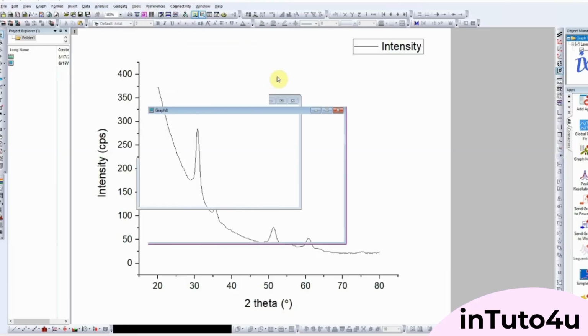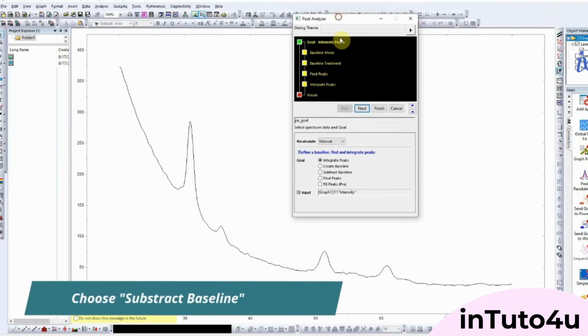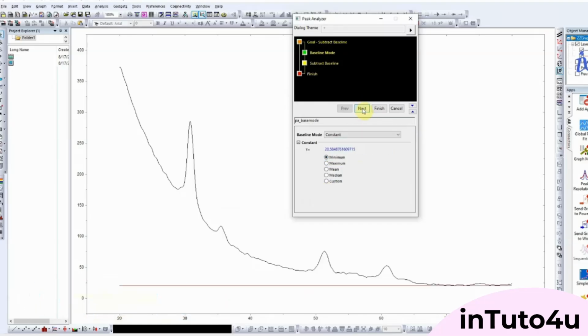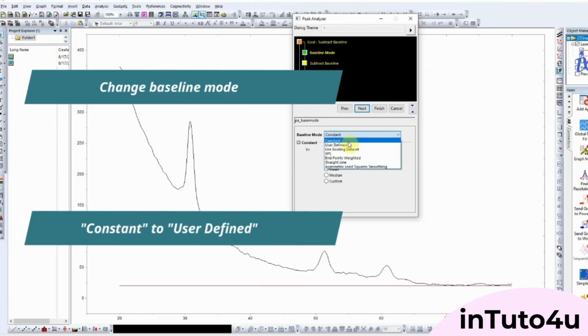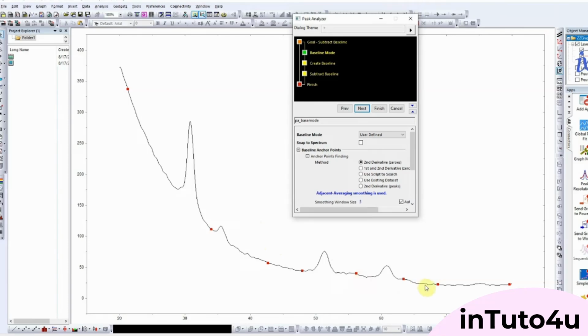Now, the Baseline Correction window will appear. Here, you'll see different methods you can use. We are going to work with the baseline. So, select Subtract Baseline and then click on Open Dialog. And then click Next. Once the dialog opens, you'll notice several options. From these, change the baseline mode from Constant to User Defined. This tells Origin that we want to remove the unwanted background from our data. After making this choice, click OK to confirm. Next, click the Next button to move forward.